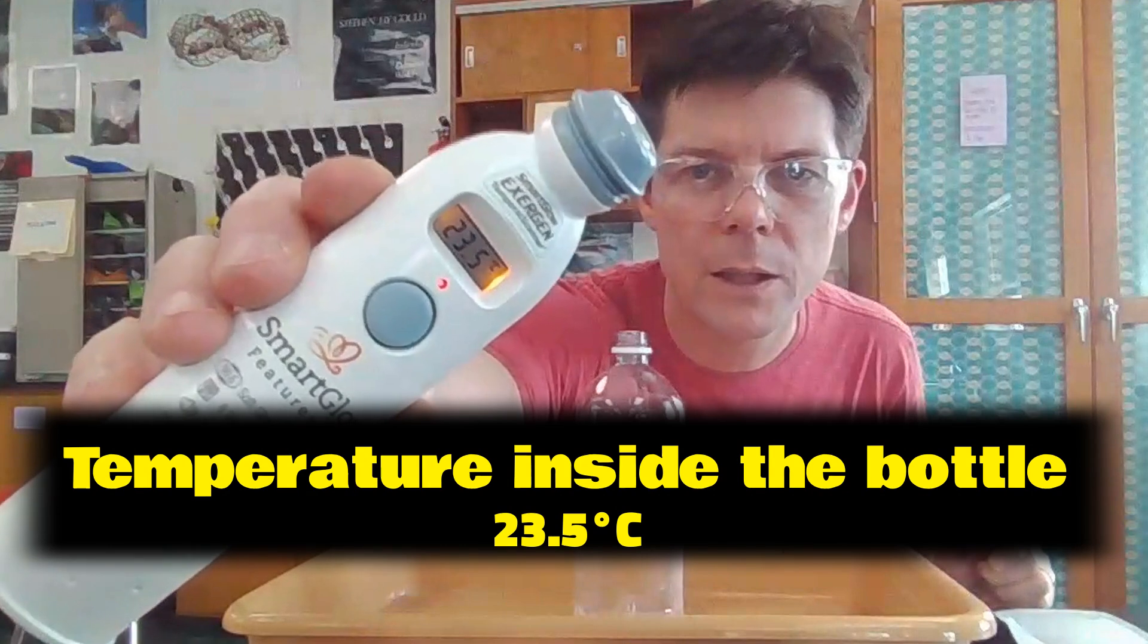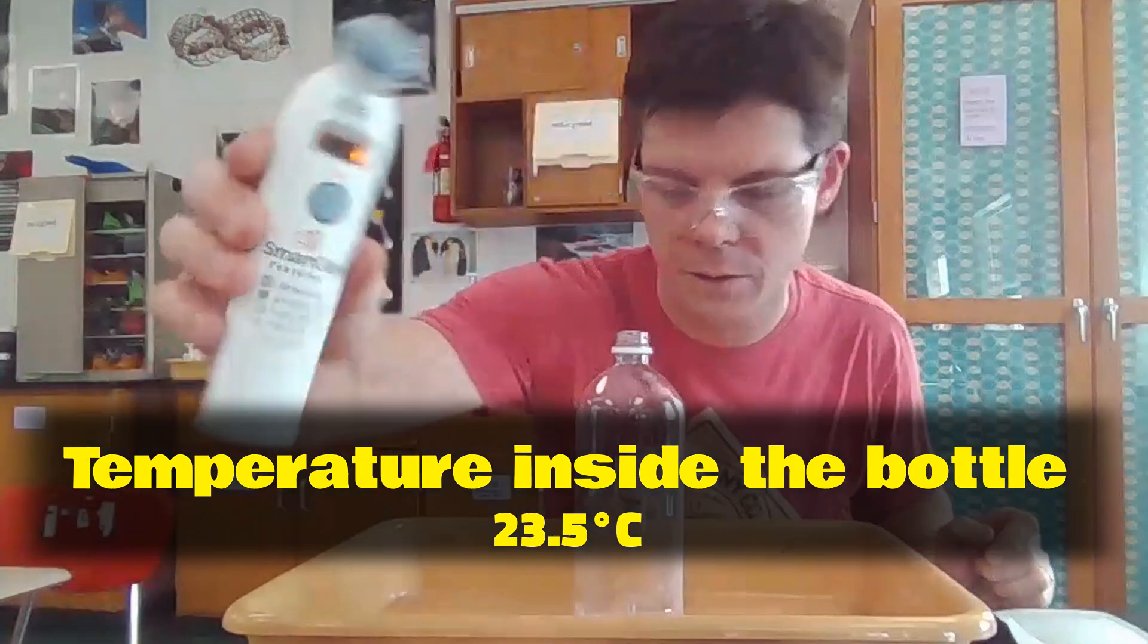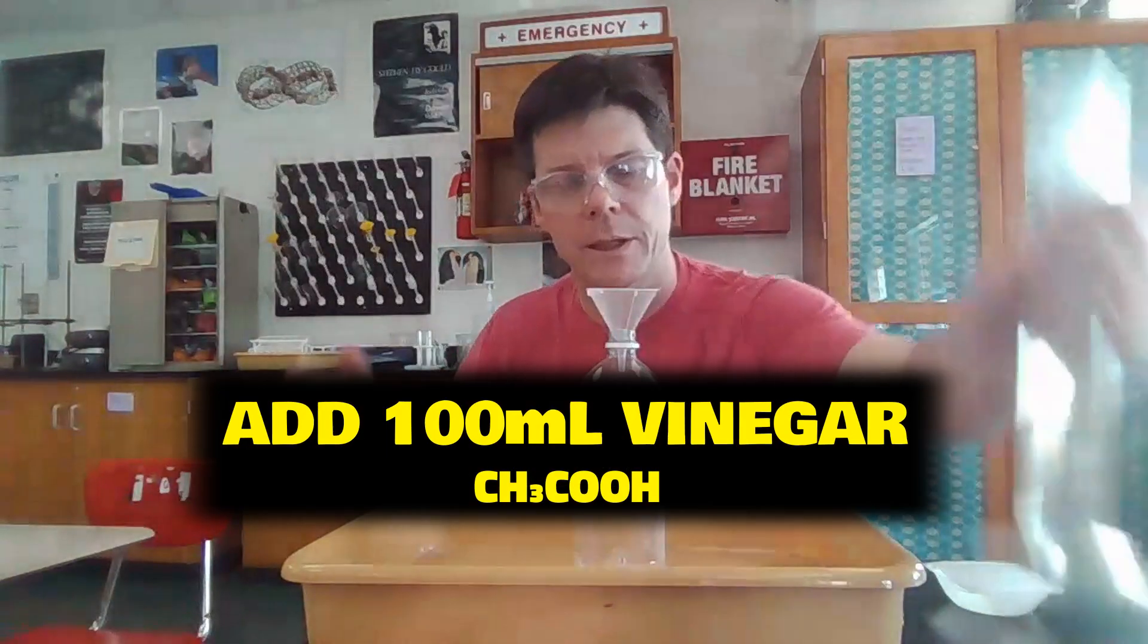Currently reading 23.5 degrees. Now I'll add the 100 milliliters of vinegar.